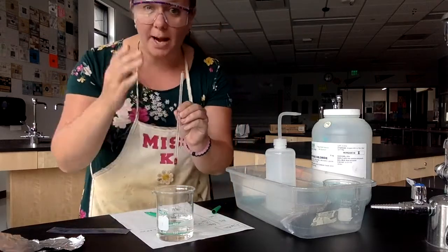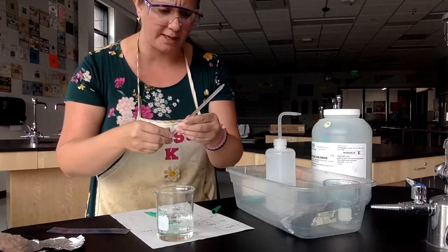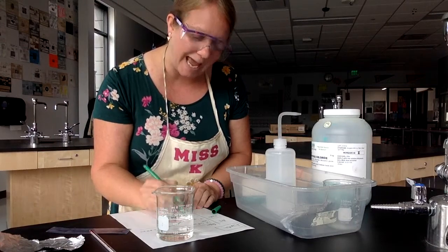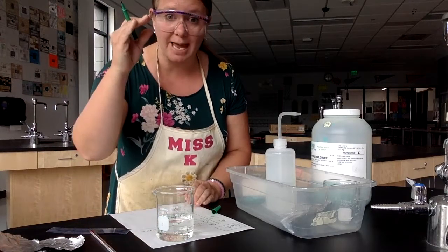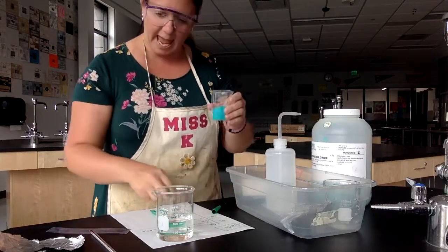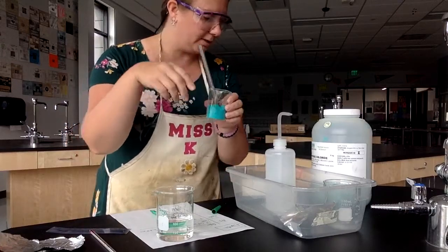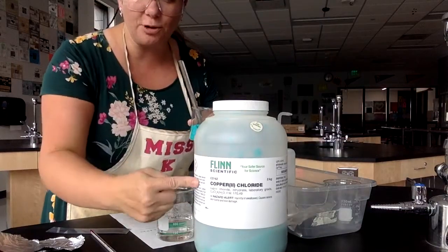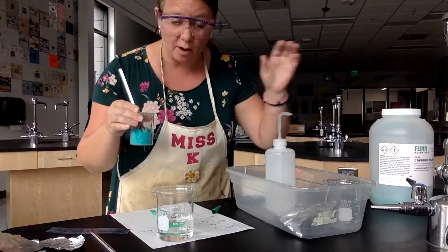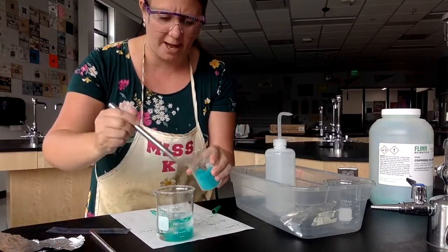This thermometer goes up by ones — 20, 21, 22, 23, 24, 25 — and I write 25.0 to show it is exactly on the 25: not past it, not below it, exactly 25.0. Then I'm going to add a couple scoops of copper(II) chloride crystals. They look like this — so the water is my first chemical and the copper(II) chloride is the other chemical I'm using. I'll do two scoops.